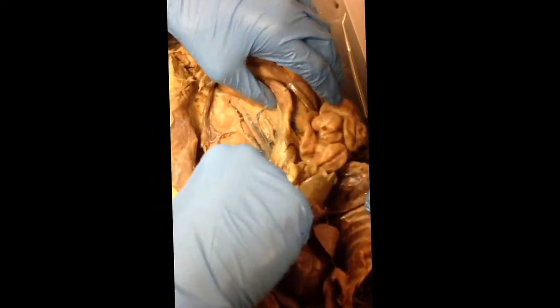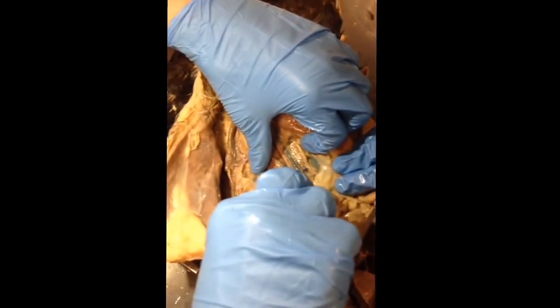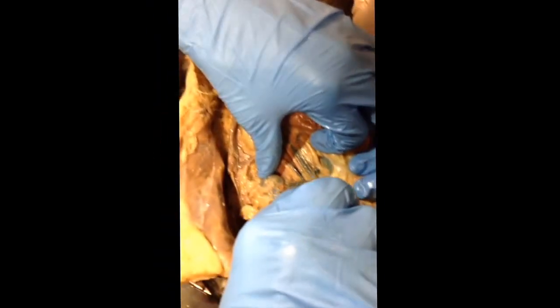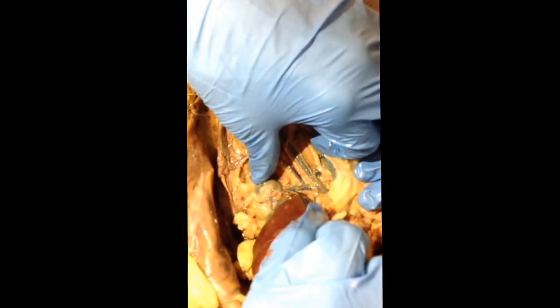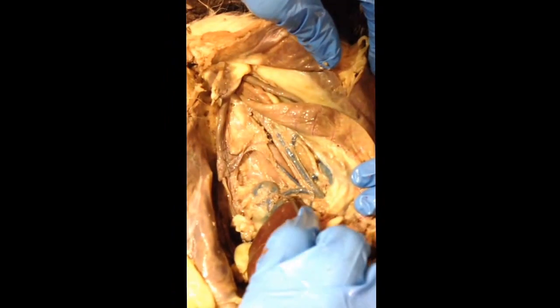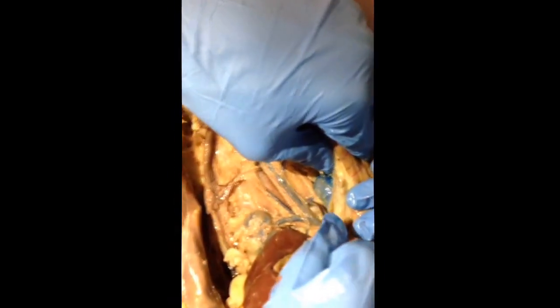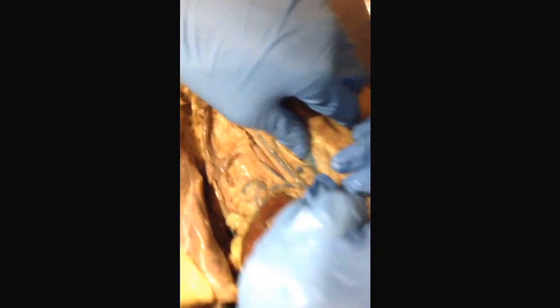Next thing is the renal vein, and the renal vein is very specific. It specifically connects, I believe, the kidney to the caudal vena cava. And it's just that individual vein. It's very short, but it attaches from the kidney to the caudal vena cava. It's on the other kidney as well, as you can see there.